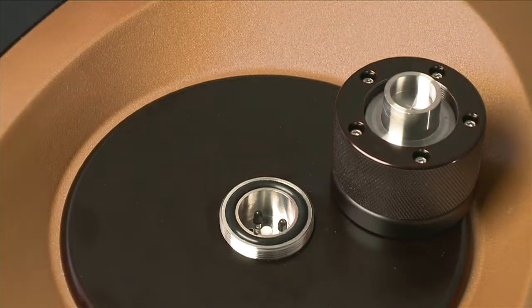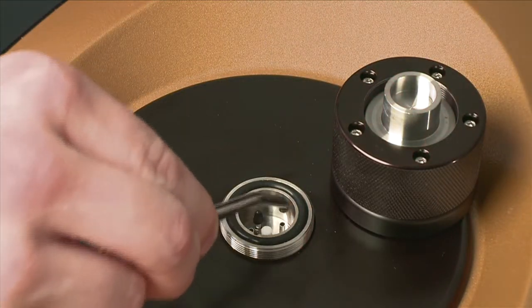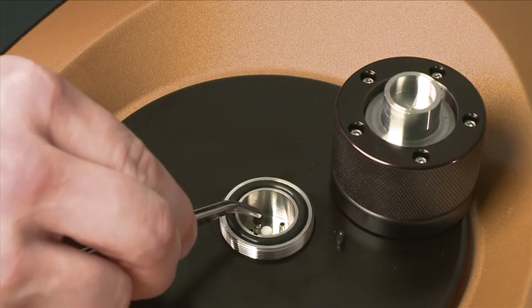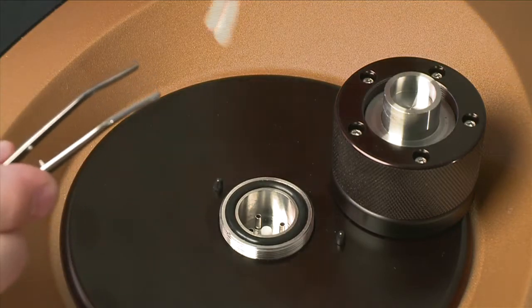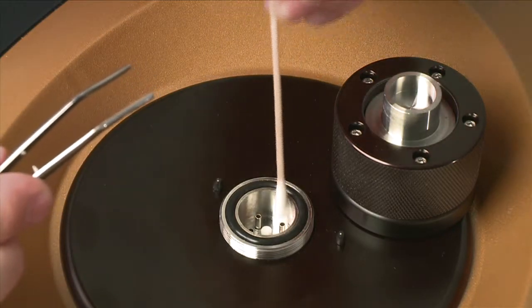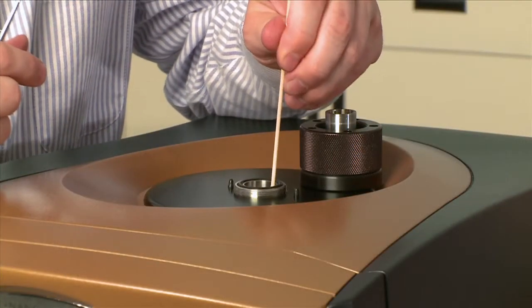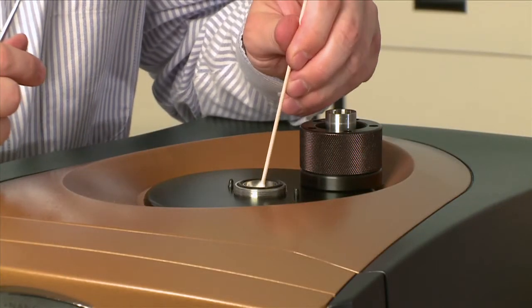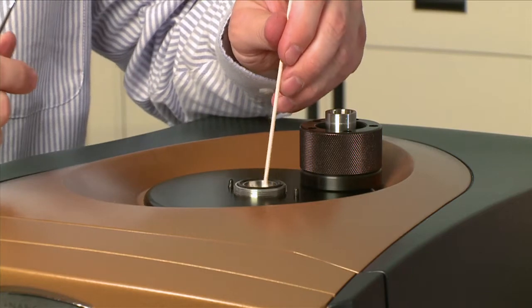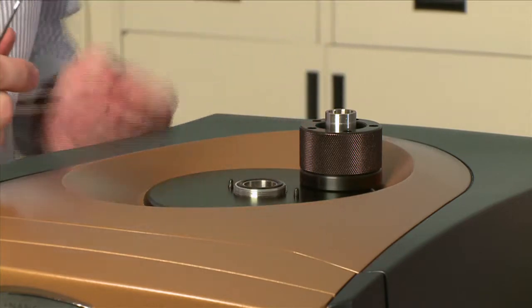Once the pressure cap is open, you probably have a couple of vinyl caps on one side of each of the sample and reference sides. We need to remove those, and you may have dropped a little bit of solution inside the wells, so we can dab that dry with a cotton swab or a piece of chem wipe or paper towel.